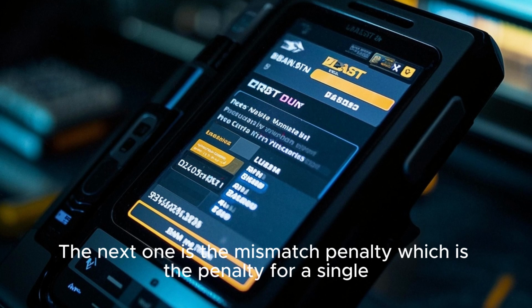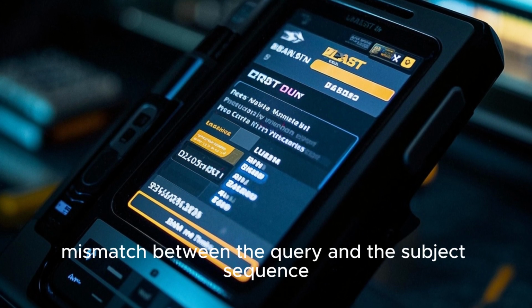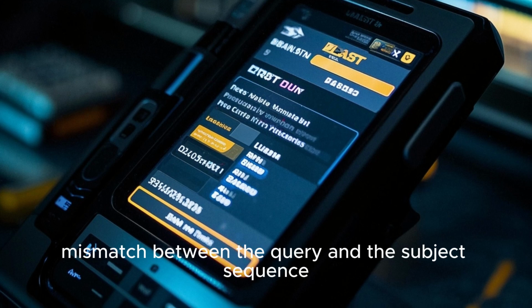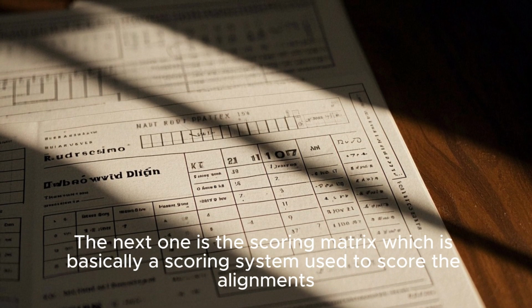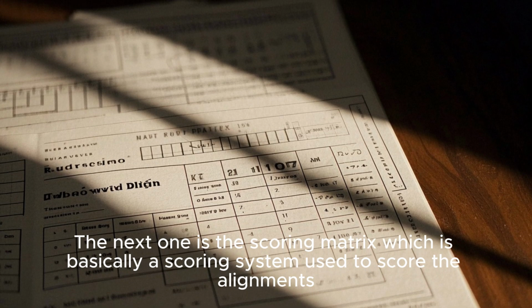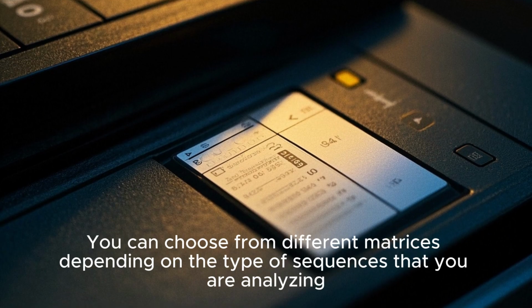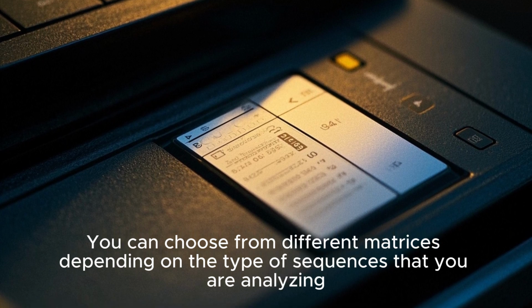The next one is the mismatch penalty, which is the penalty for a single mismatch between the query and the subject sequence. You can also leave this on its default value. The next one is the scoring matrix, which is basically a scoring system used to score the alignments. You can choose from different matrices depending on the type of sequences that you are analyzing.